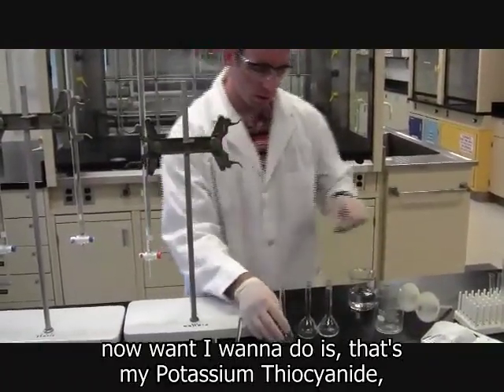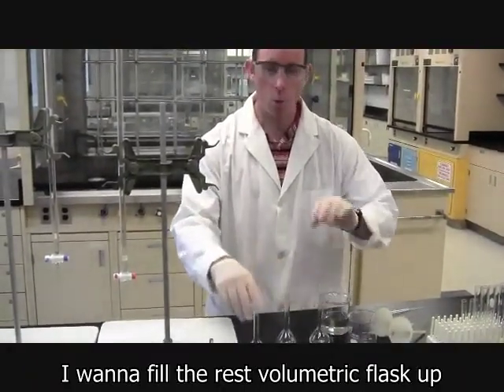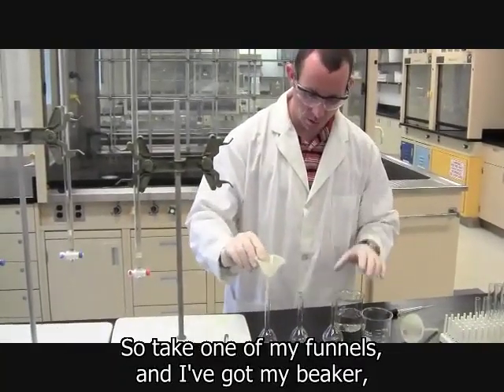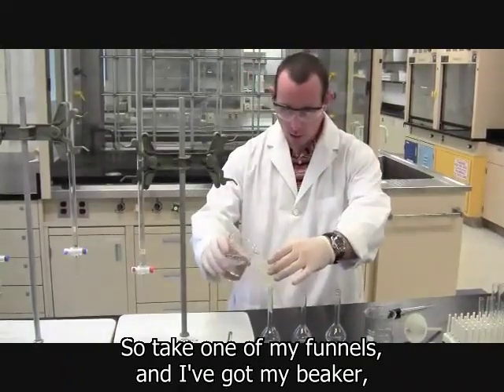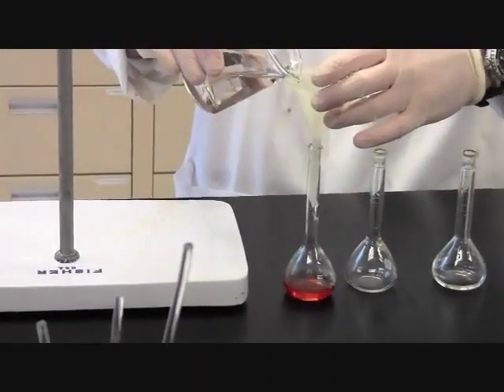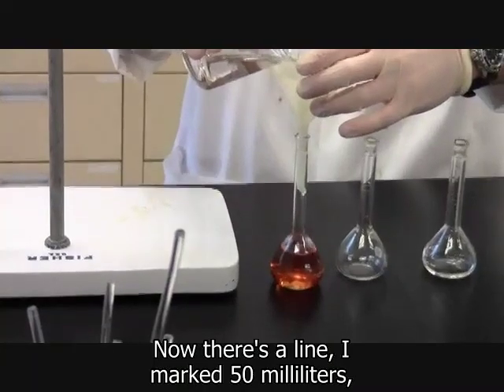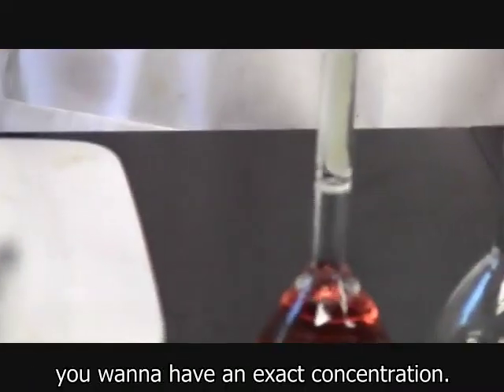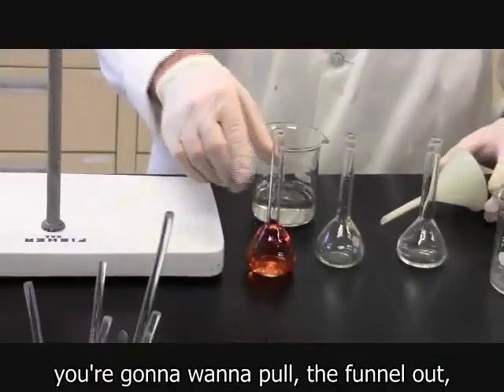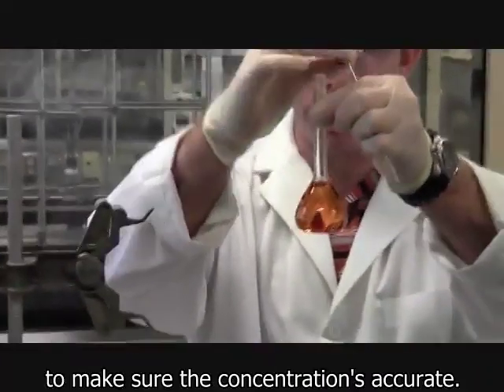Now that's my potassium thiocyanate. I want to fill the rest of the volumetric flask up with just pure concentrated iron nitrate. So I'm going to take one of my funnels, and I've got my beaker, and I'm going to slowly pour in the iron nitrate. Now there's a line that marks 50 milliliters. You want to have an exact concentration. When you get close to the top, you're going to want to pull the funnel out, and I want to get right up to the top to make sure the concentration is accurate.